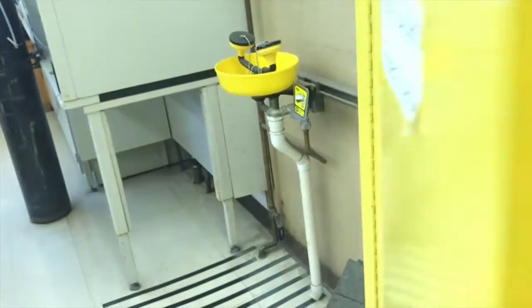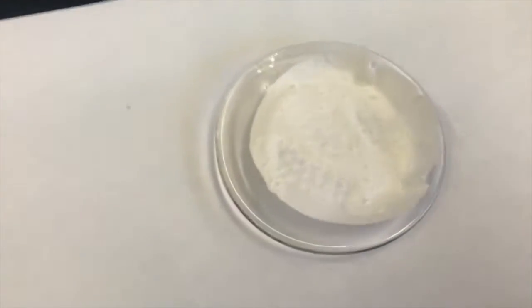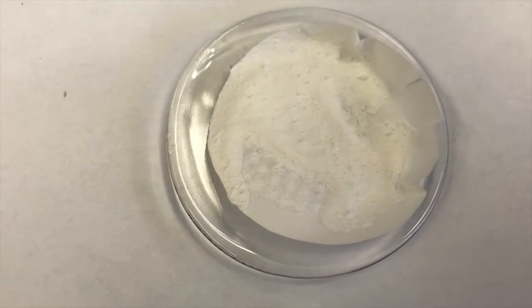So I got my methanol over here in the flammable cabinet. I've got ethanol as well. You want the crystallization solvent to dissolve your molecule okay. Not great, but not terribly, because you want it to be able to dissolve while it's hot, and then when it cools, you're hoping it'll recrystallize. Oh, I just noticed too, over here, here's our aqueous layer product. Remember, that's a carboxylic acid from before.